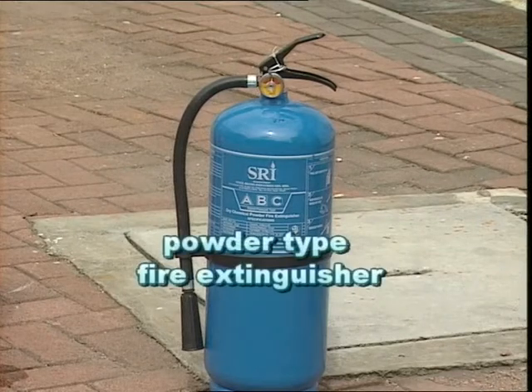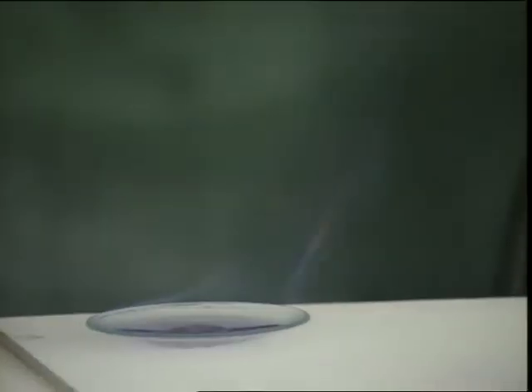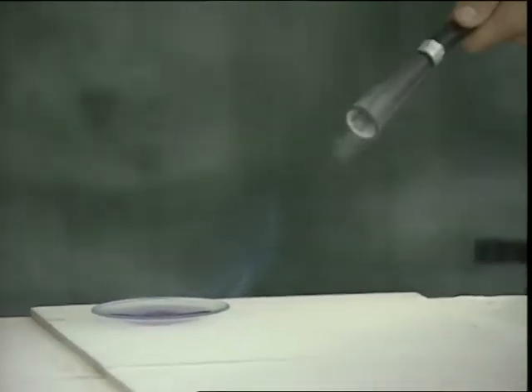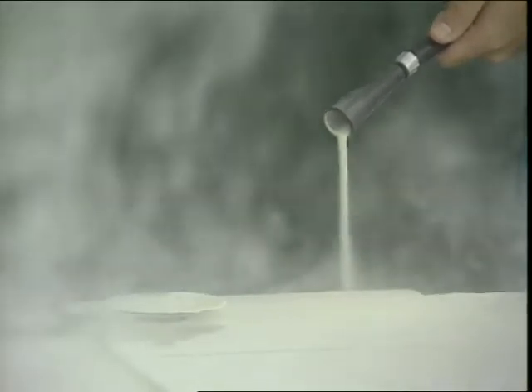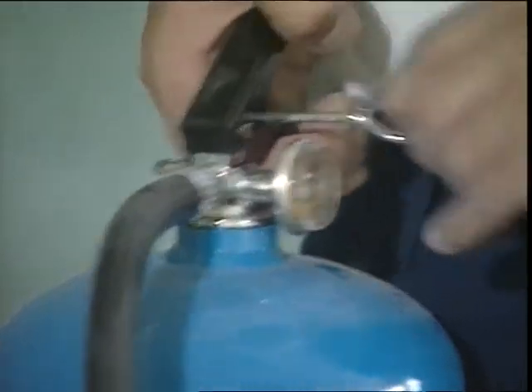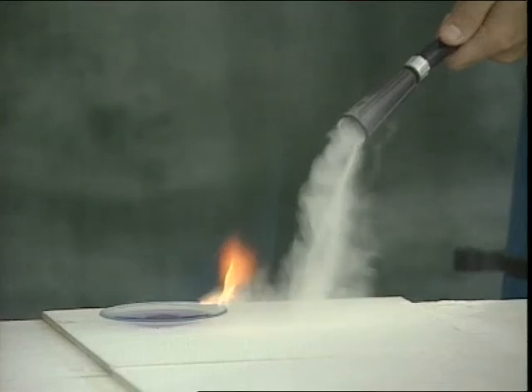The third type is the powder type fire extinguisher, which is filled with a chemical powder. This type of fire extinguisher can be used to put out fires caused by flammable substances, chemicals and electric sparks. To use this type of fire extinguisher, pull out the safety pin first, then point the opening of the extinguisher towards the fire and press the handle.